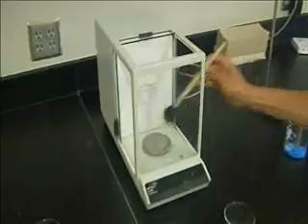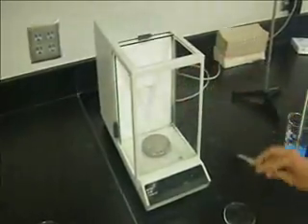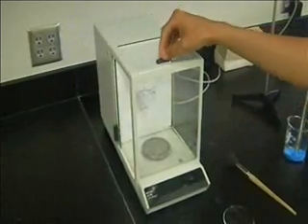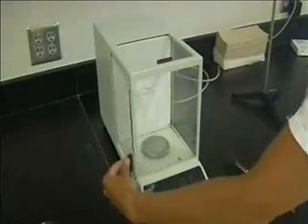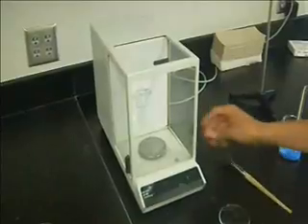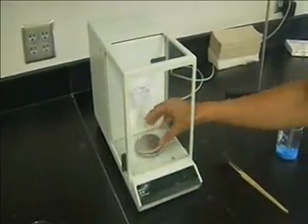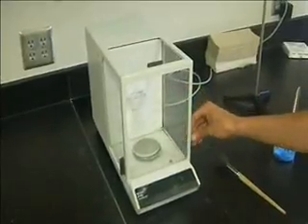When using a balance, the display must be zeroed out before beginning any measurements. This can be done by pressing the zero button after cleaning the scale with the doors closed. This will result in the balance displaying the total weight of an object placed on the weighing platform. If only the transferred substance should be measured, the empty glassware can be placed on the weighing platform when the scale is zeroed. This is called a tare weight.